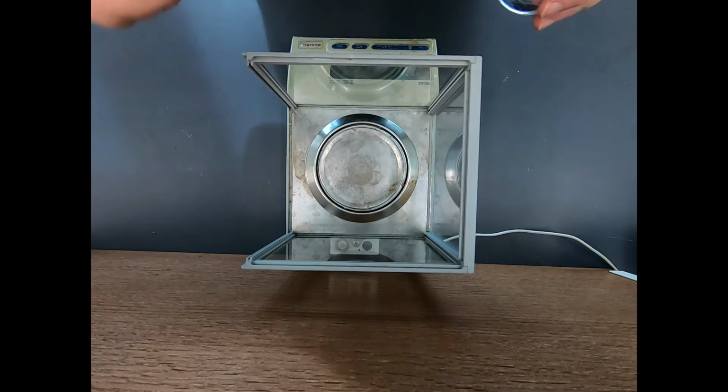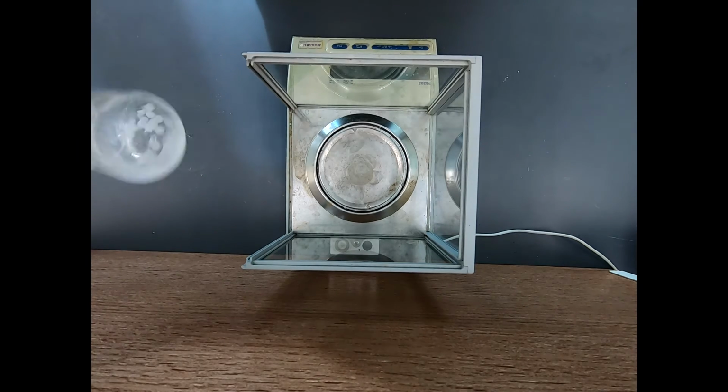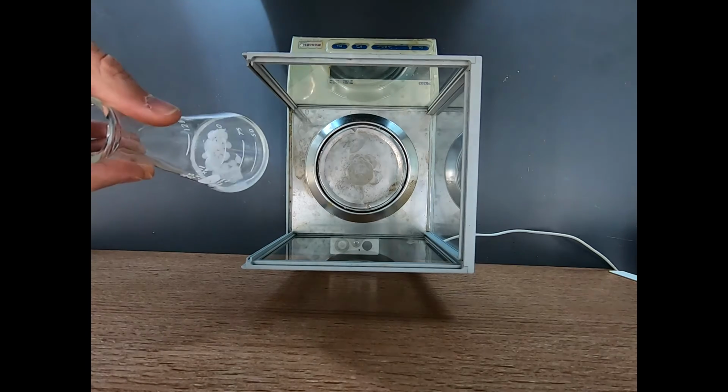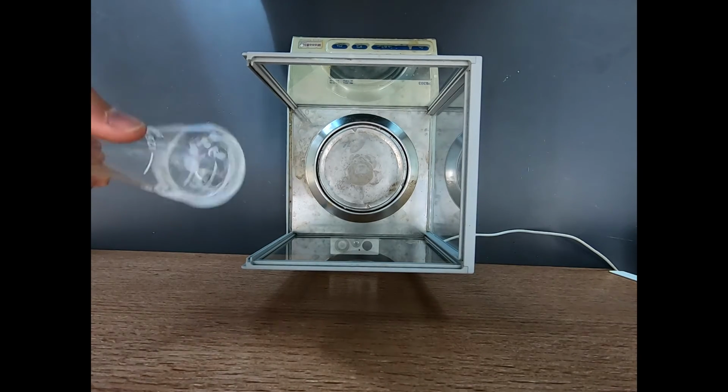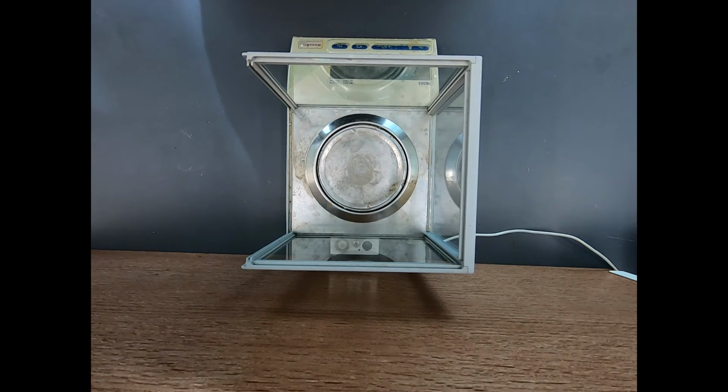So I'm going to go ahead and take this 5.1 grams in all, and right here at the balance, put it in 30 milliliters of 1-to-1 ethanol water, and I'm going to put that to the side. So that is doing its thing, ready to go, even if it is more than I intended to have.